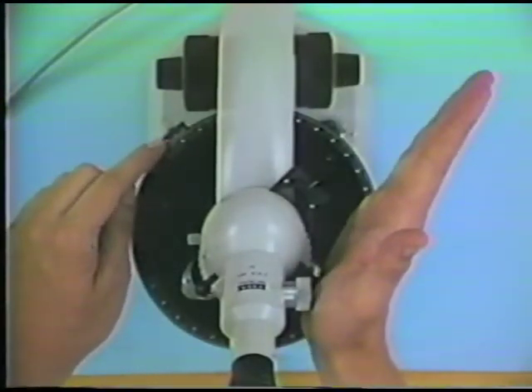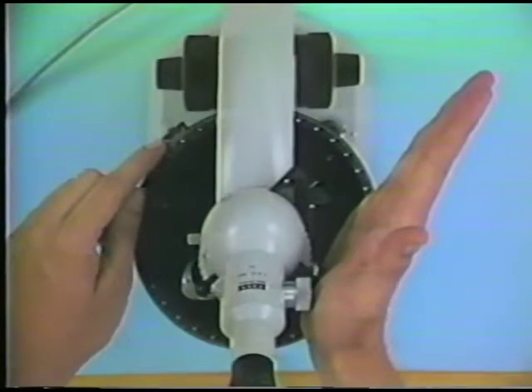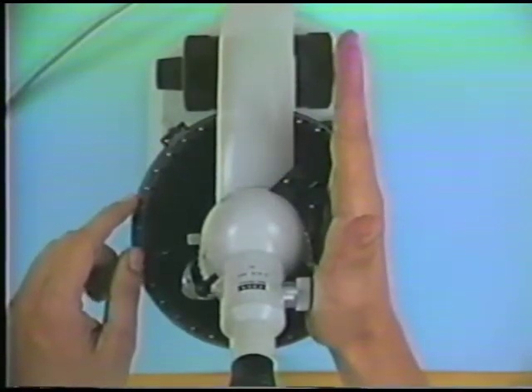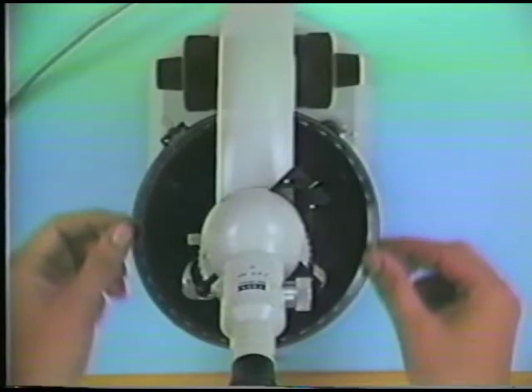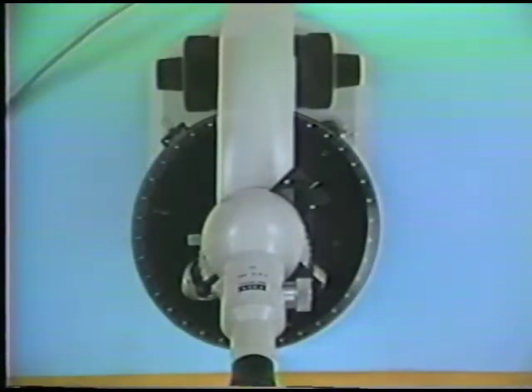And so inclined extinction is a bit more complex than the other properties, because often we want to measure the angle of inclination between extinction and elongation of the mineral. And if we need to measure that angle, we can use again the graduations on the stage itself in order to measure this angle.